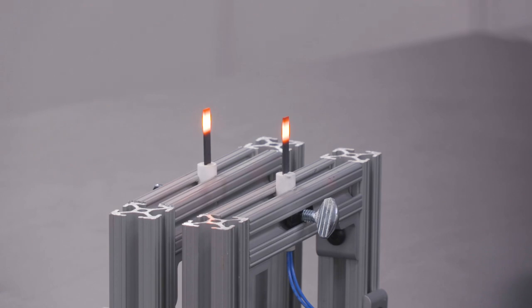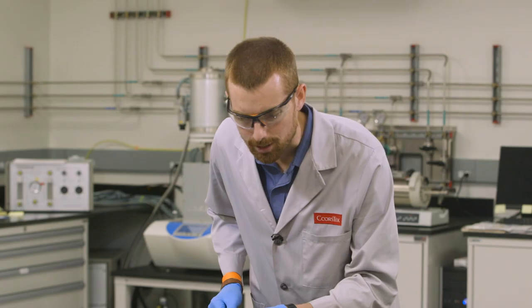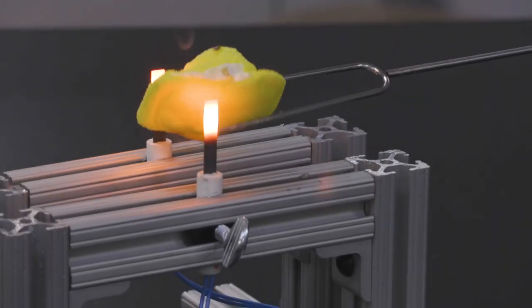See in about five or six seconds or so, they've already reached their maximum temperature. A little bit of smoke coming off now. I see a little bit of fire.